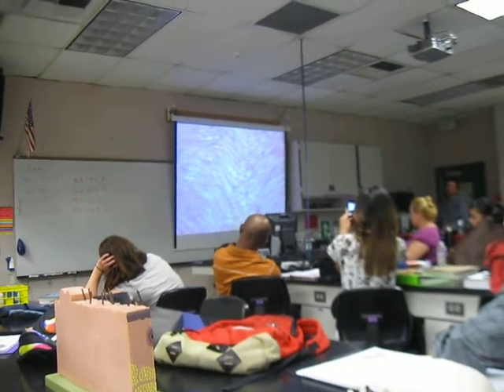Now this particular section is a longitudinal section, same nerve, same classical arrangement, just now we're looking more longitudinally rather than cross-sectionally. You can still identify the axons. Most of what you're seeing here is all the myelin surrounding the axons.